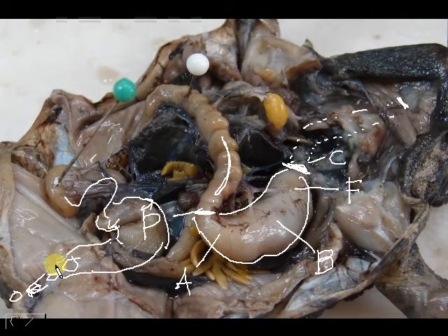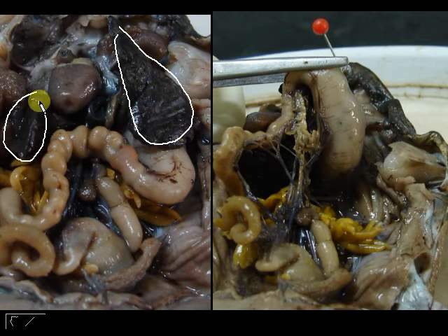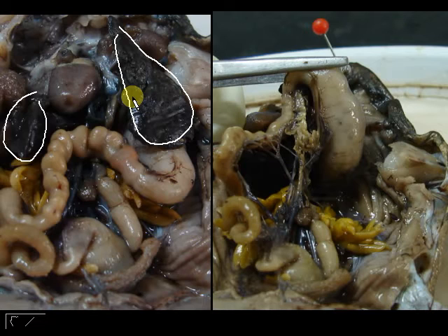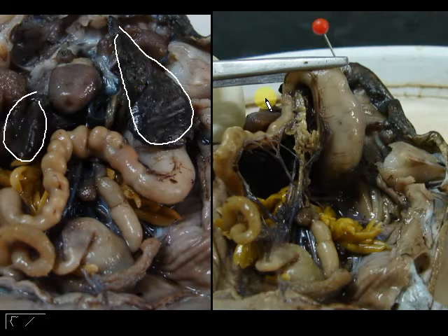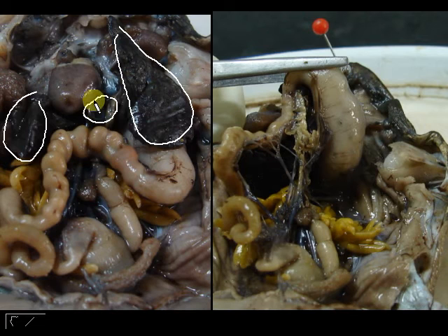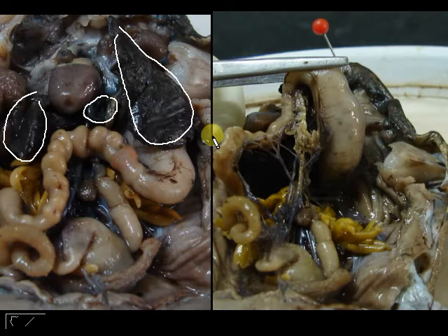Now we will discuss the accessory glands involved in digestion. First off is the liver — this entire dark part here. It is normally bigger, but I have cut some away to see the other organs. The liver secretes bile, which helps to emulsify and digest fats. This bile is stored in a greenish-bluish sack right behind the heart, called the gallbladder.